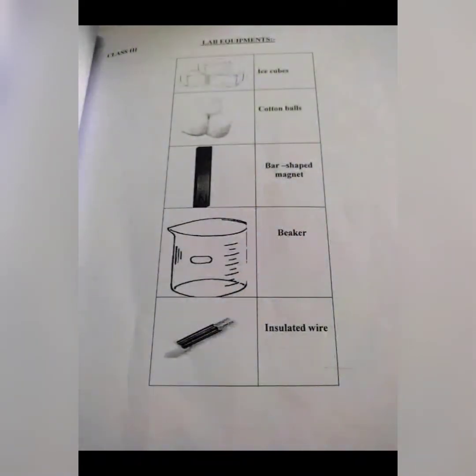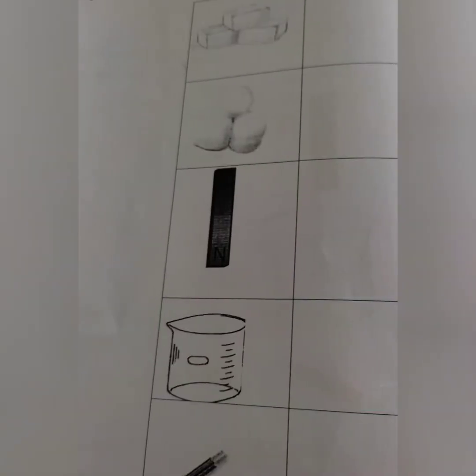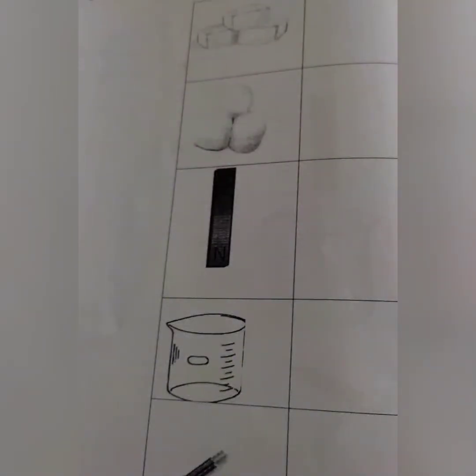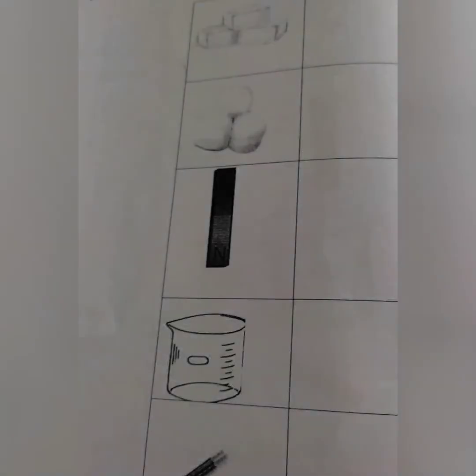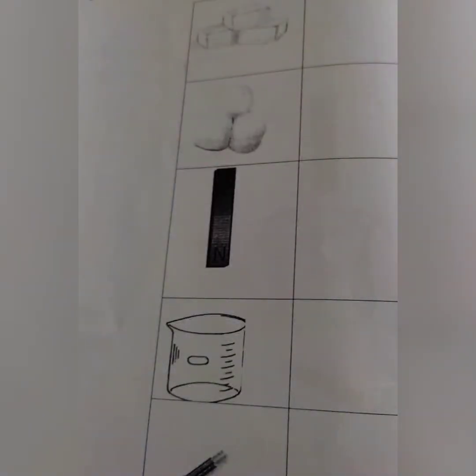Now come to the next page. This is your practice worksheet. Question number 1 is: write the names of the following lab equipment. You have to learn the lab equipment and write their names in your worksheet pad.